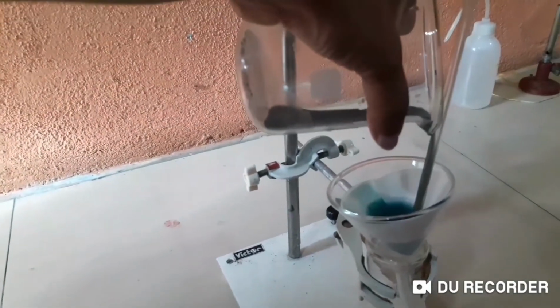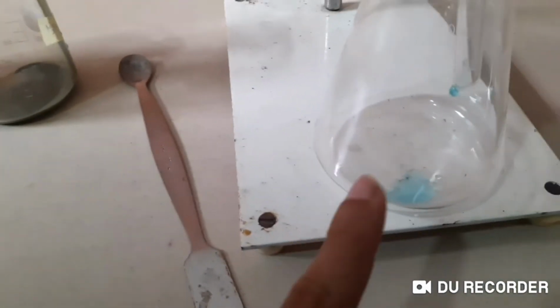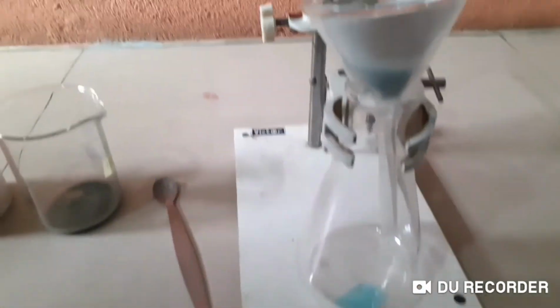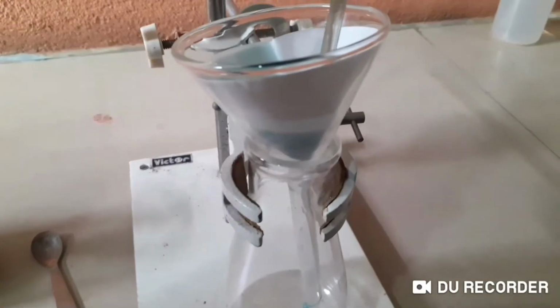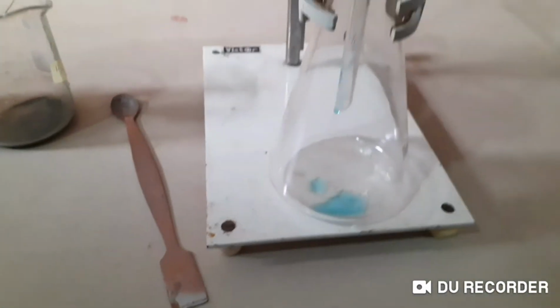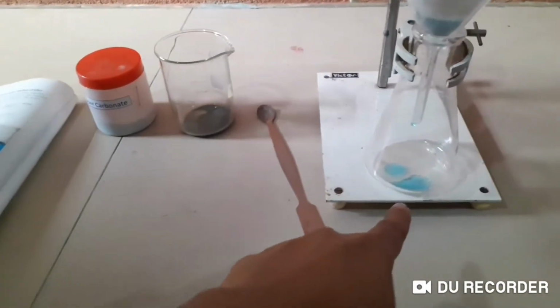I actually want to get my copper sulphate into the solution, to the container. You can see a solution is made. That is copper sulphate. Actually, you can see that's filtering out. That's copper sulphate. You can see that color, right? Ashali, can you see? Don't push it on hard, right, darling? Now we have to leave it aside for a while. You will see it's turning nice blue. Now that's copper sulphate. Okay, we filtered.